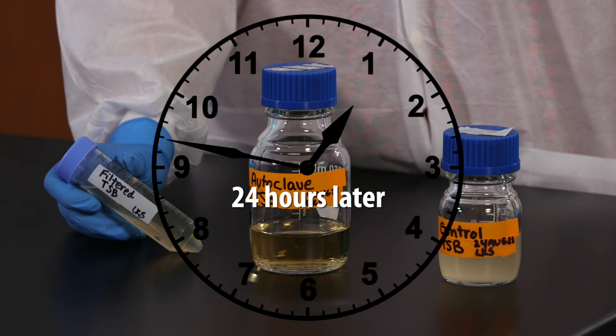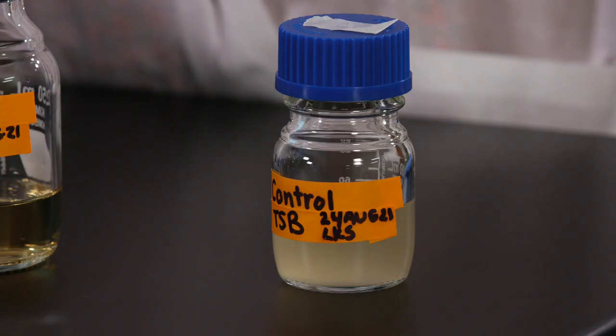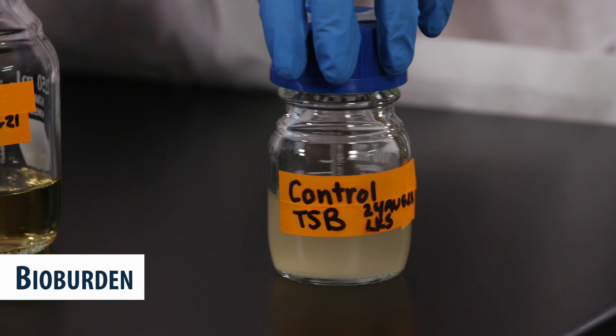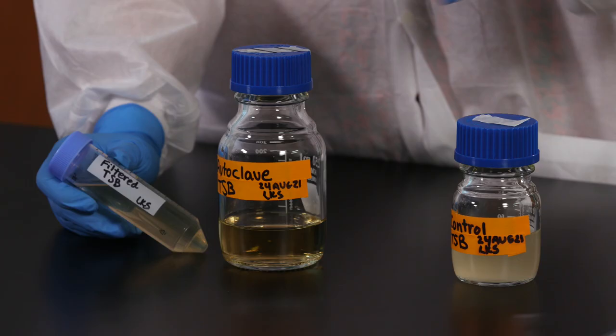It's been 24 hours. Now let's compare our results. See how our control is cloudy? That means there's microbial growth in there. We call that bioburden. So the control media is definitely not sterile.